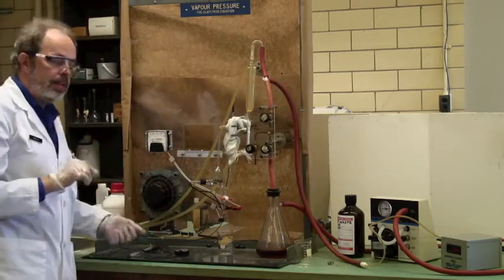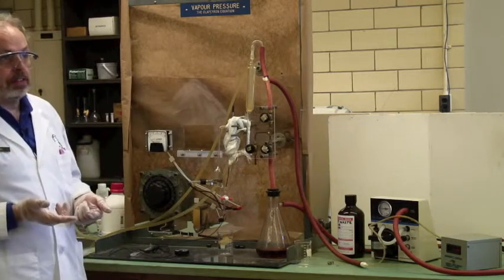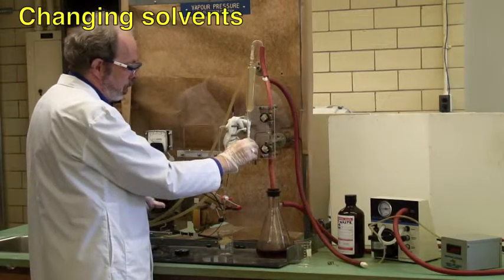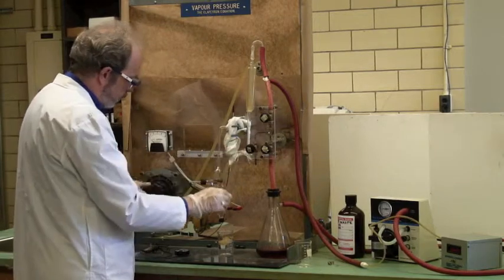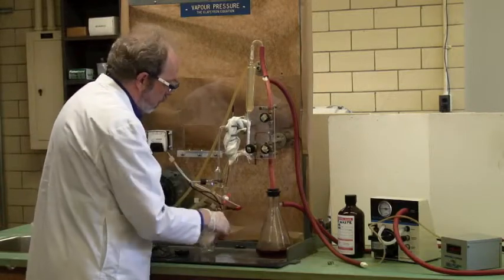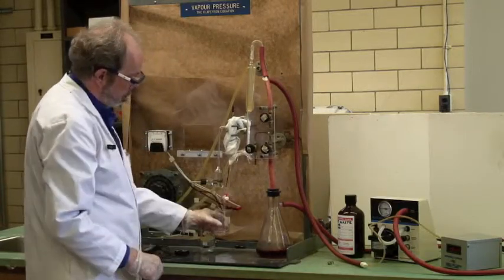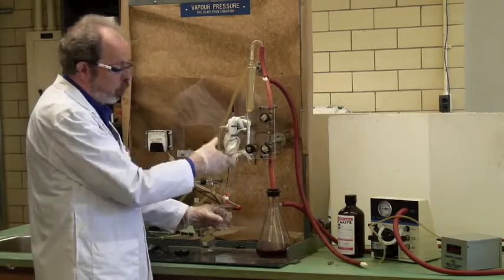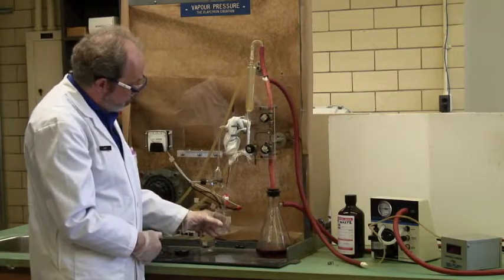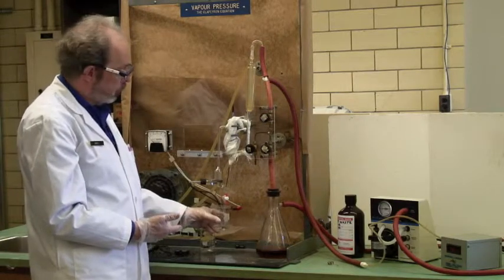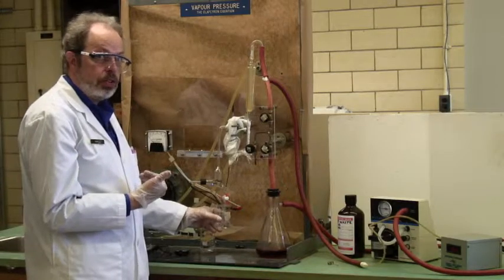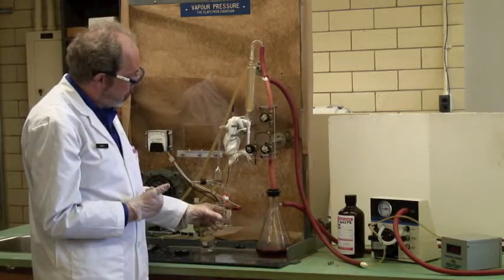Once you have done that, it's time to drain and move on to a second solvent. So the first thing you do is make sure that it's completely at atmospheric pressure. So I open this, make sure this is off and open. I need a waste beaker here. Let's open this tap, and if this isn't open, it won't flow. You'll get gurgles and bubbles coming out. But you drain the boiler of whatever solvent you were using. Then you rinse it with whatever your second solvent is, and your TA will talk to you about the different solvents that you need to be using.